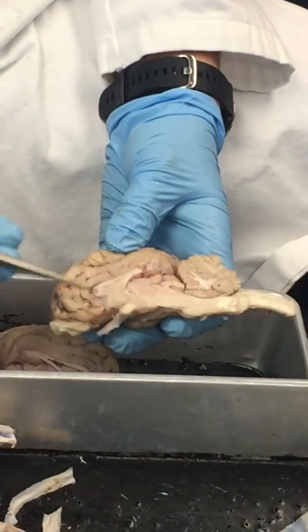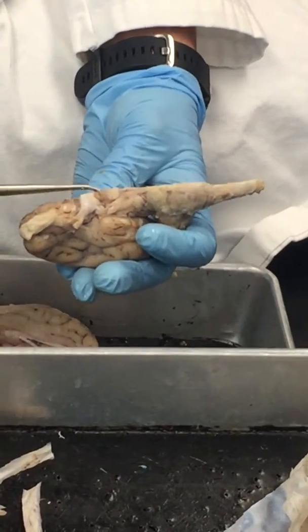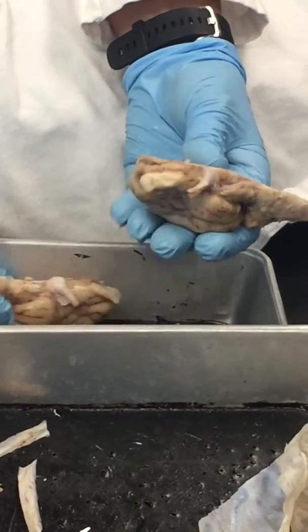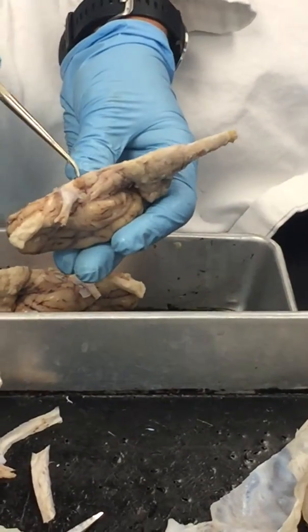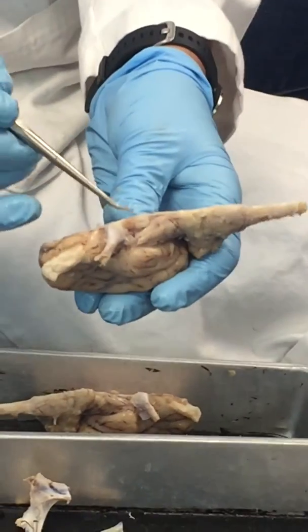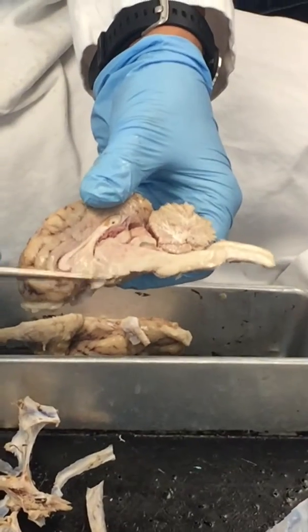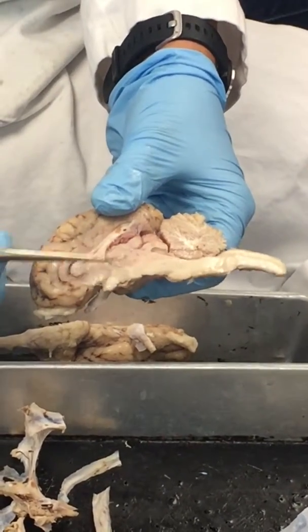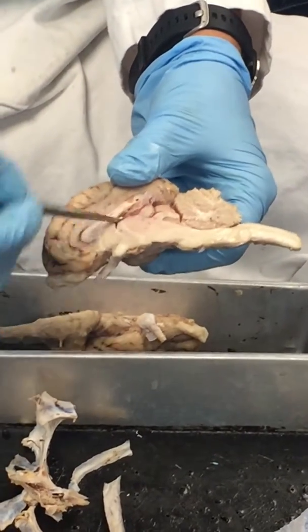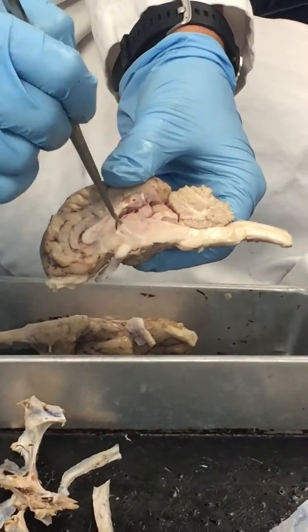Our thalamus is here. Our hypothalamus would be down in this area. That's where our optic chiasm is. Here's the infundibulum and that pituitary. They kept their pituitary gland on for the most part when they cut it, and so that's what you can see right here. I don't know, did you see that? So we have this pituitary, the infundibulum coming right off of that hypothalamus right here. So you have your thalamus, the hypothalamus, the pineal gland on that epithalamus, and this choroid that goes around this third ventricle kind of surrounds this whole area.